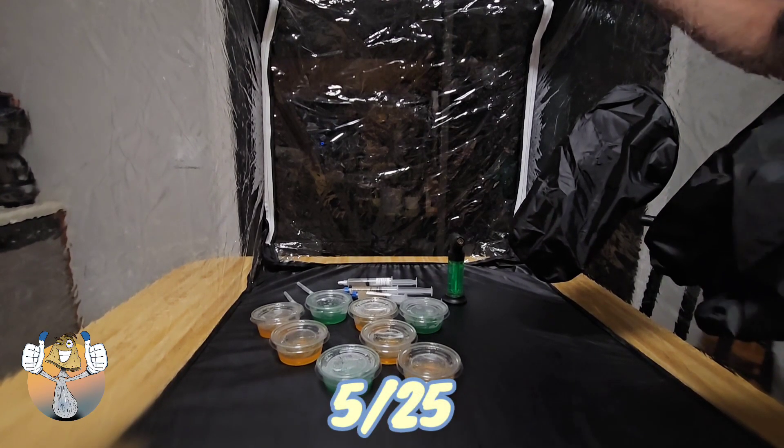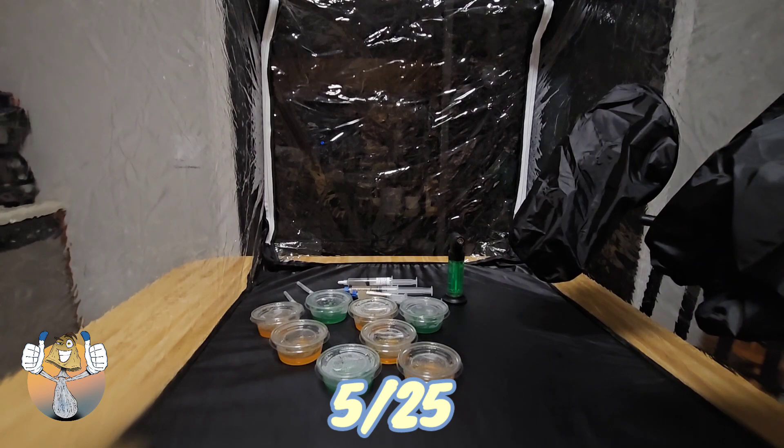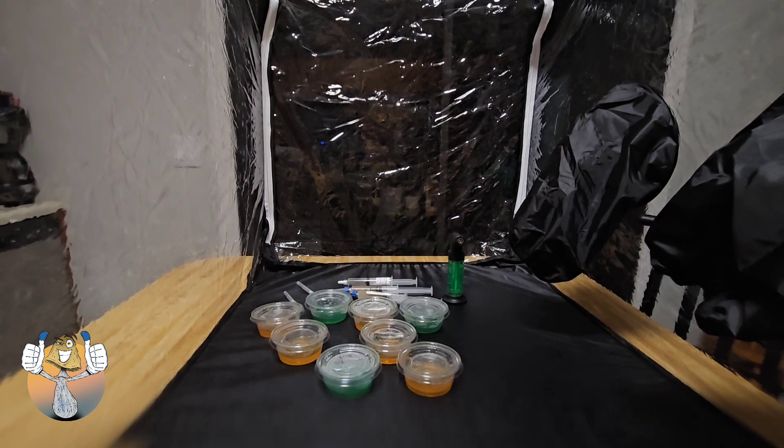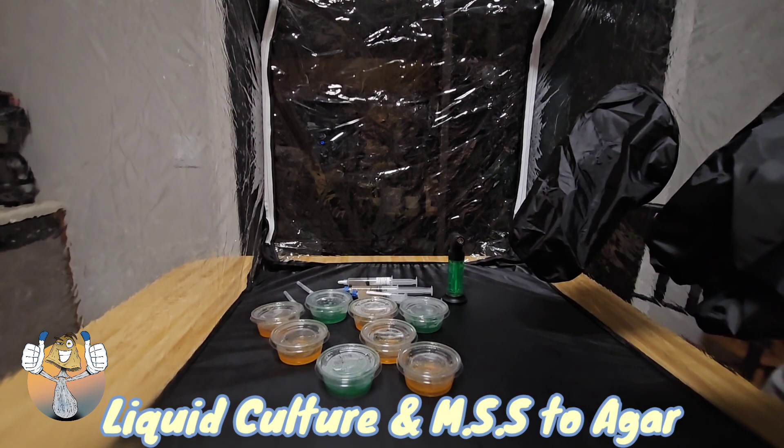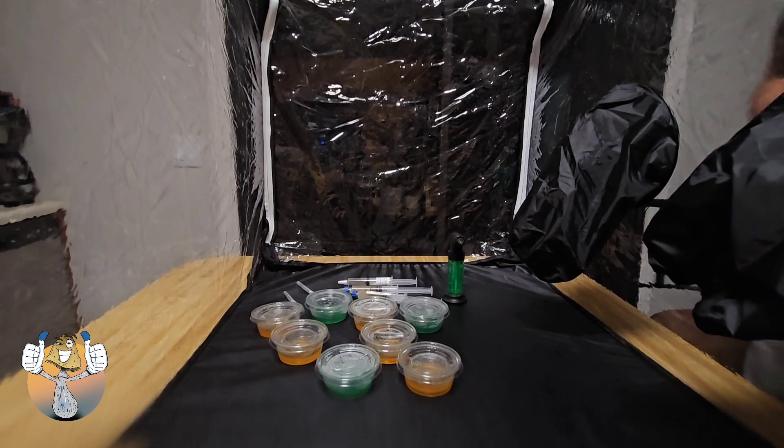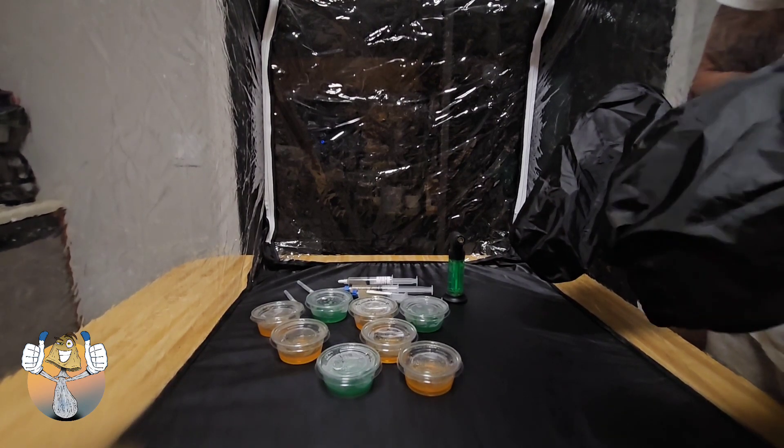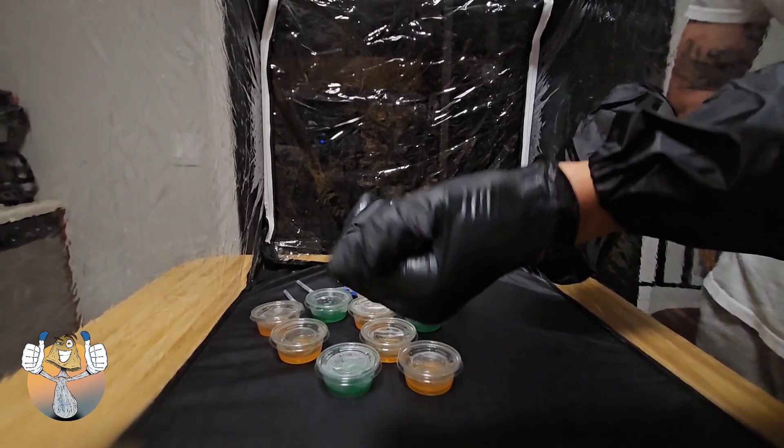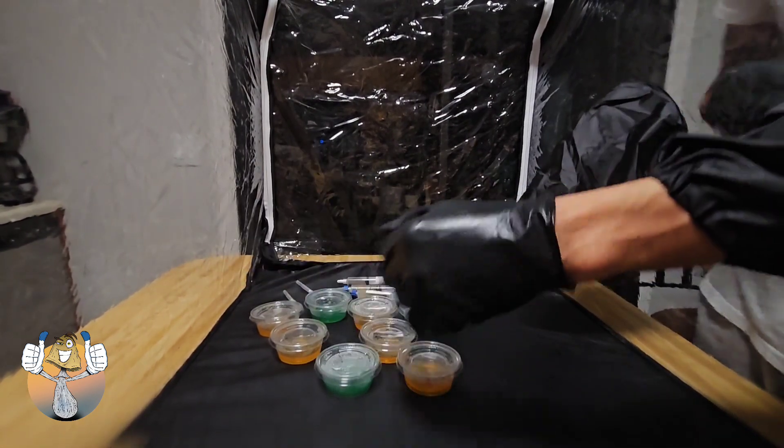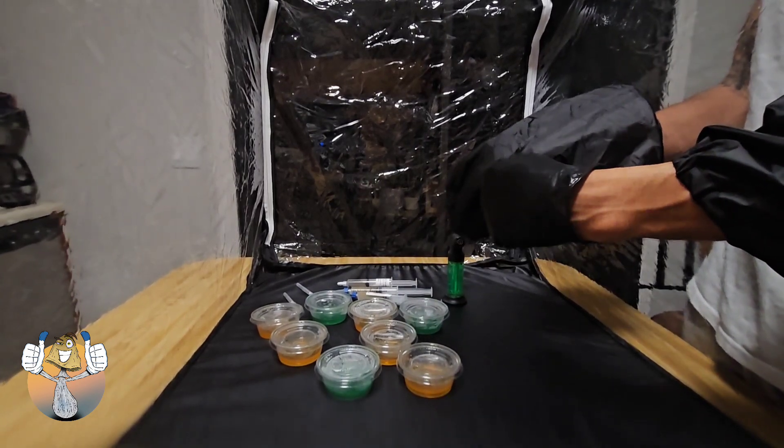Yo what's going on shroomies, what's going on shroomettes, how y'all feeling? Hope everybody's all right. Let's get down to it. Today we're going to try our first attempt to inoculate these agar plates with two liquid cultures and one multi-spore syringe.